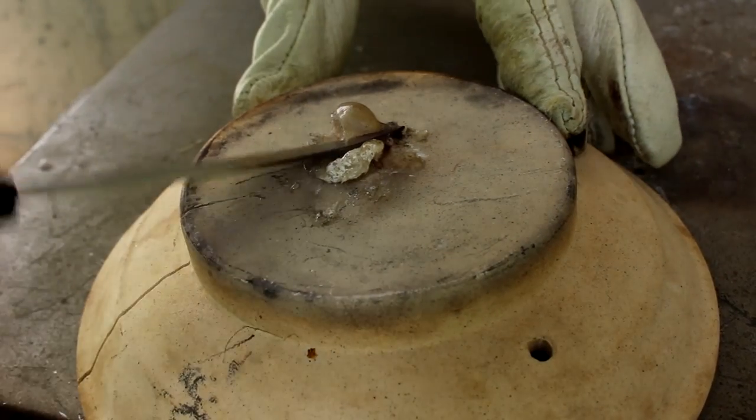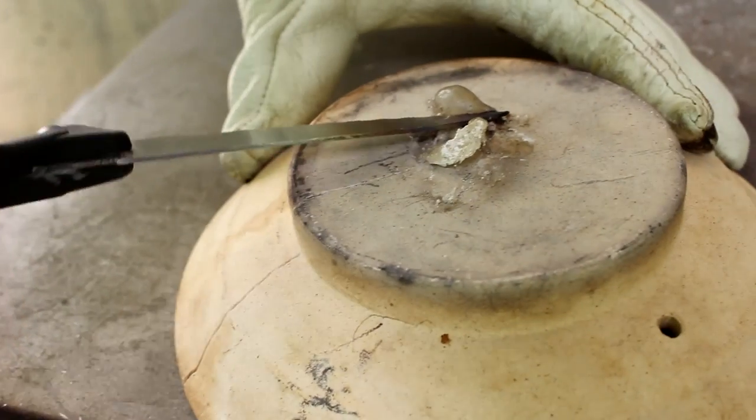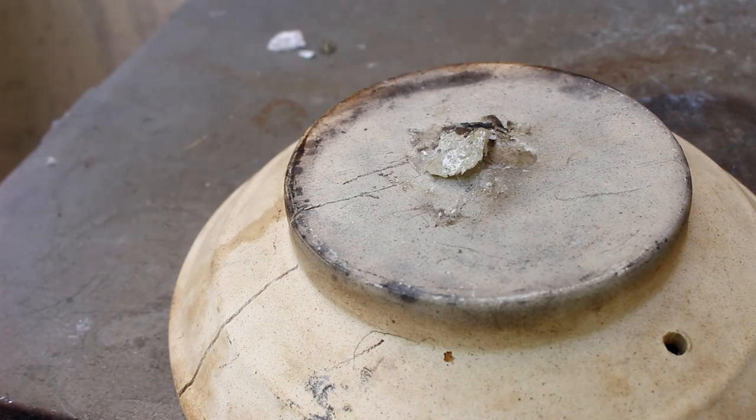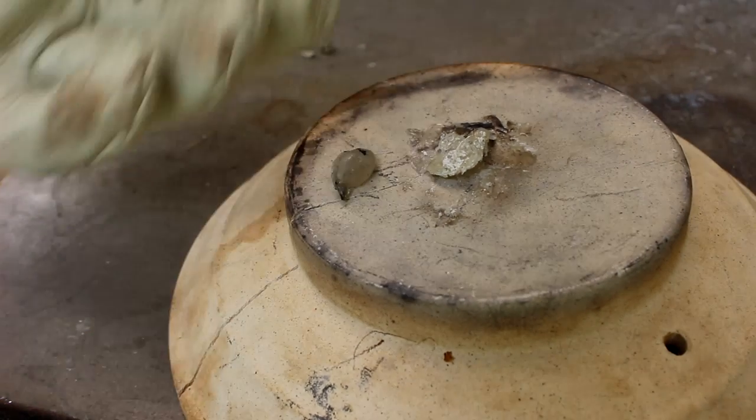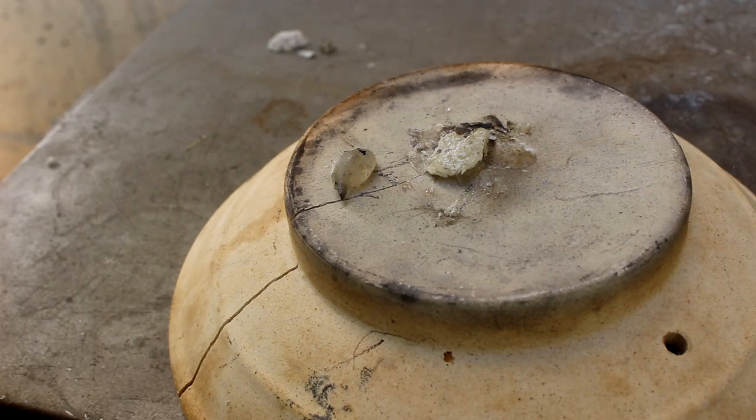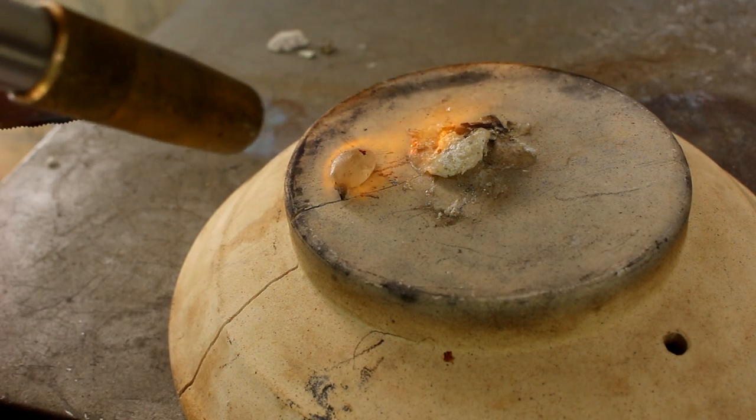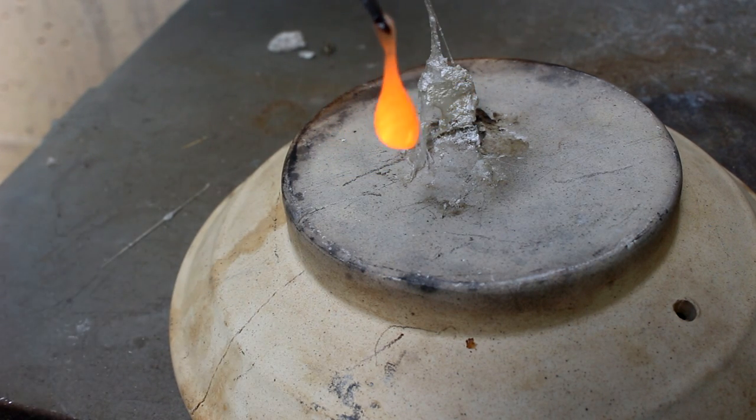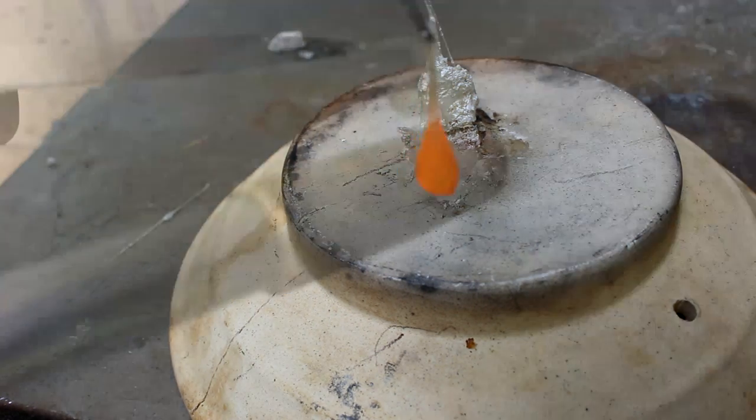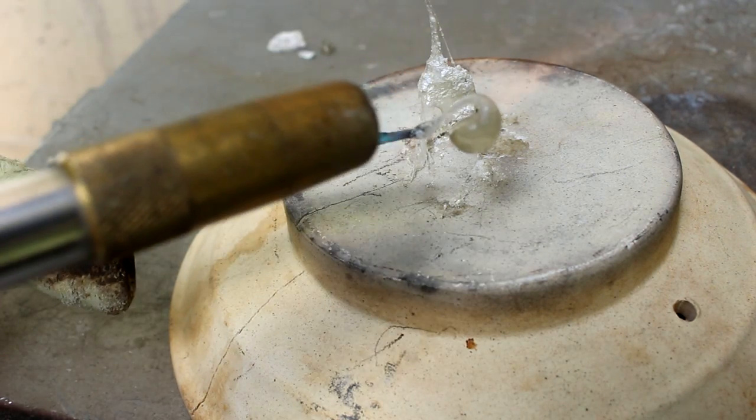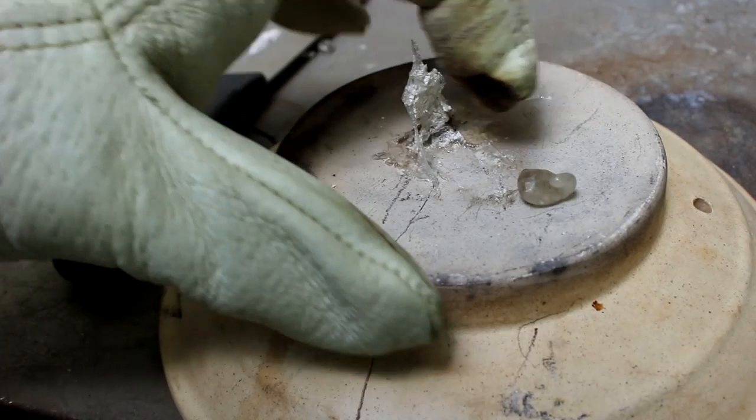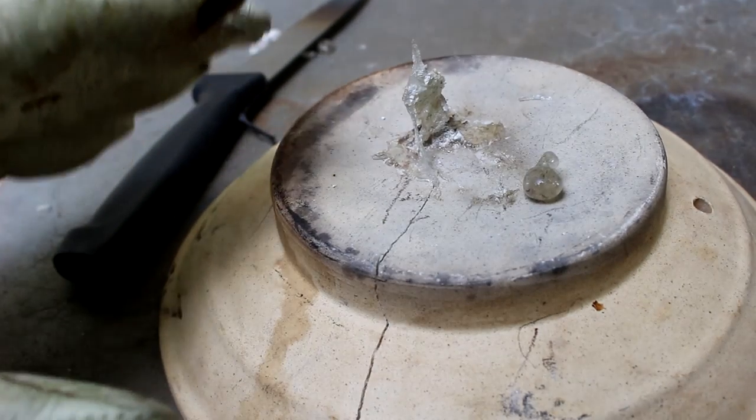You know what this is? This is a knife versus red hot glass. There it is. I burned my glove on it. So that's something. Let's quickly put that back in the furnace so it cools slowly.